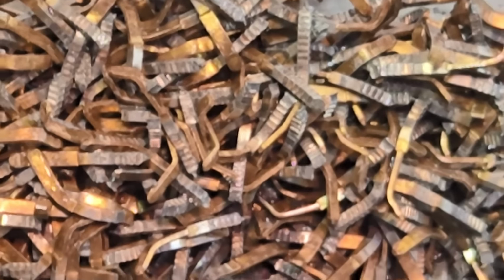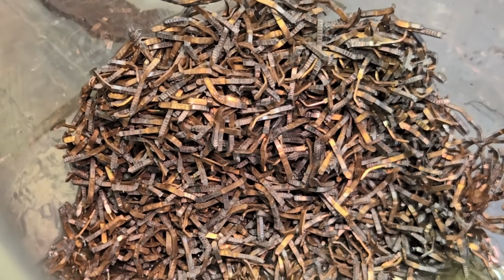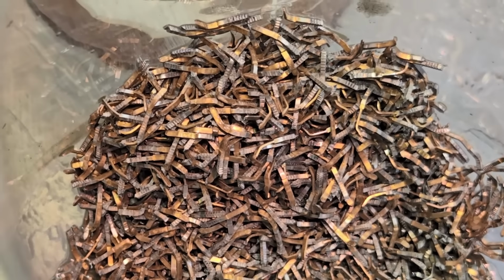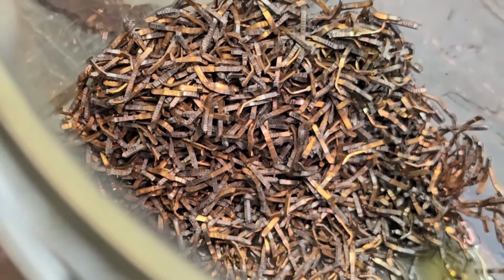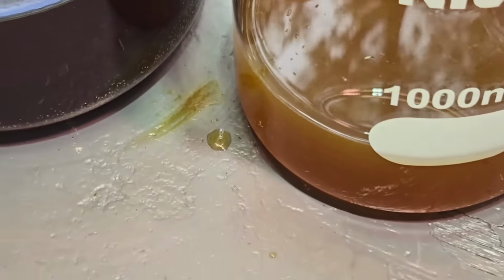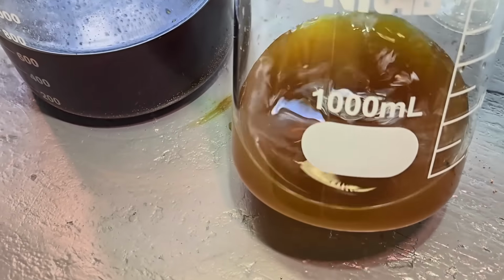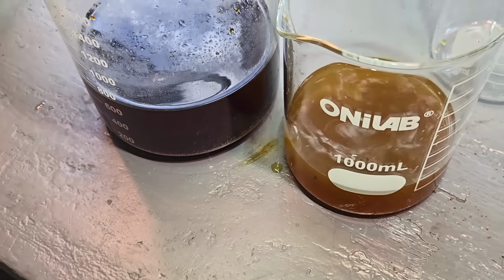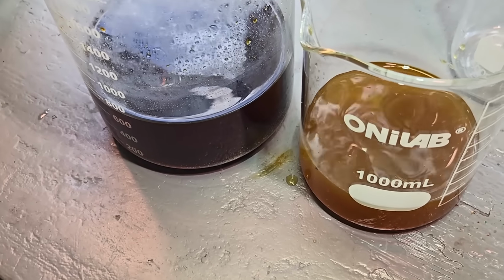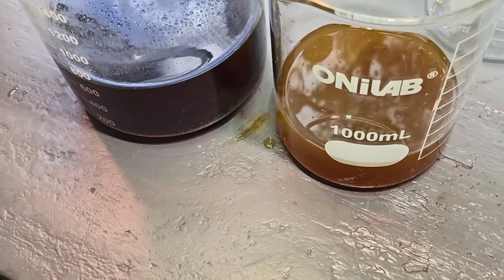I mean, I can still see gold in places, but certainly a lot of it has been removed, and in only 15 minutes, which is pretty darn good, considering it was taking me longer than that to get to this stage before. And look at the difference in the color of the liquid here. What we started with over here and what we poured off. But it's still pretty clear. It hasn't loaded down with a lot of what I assume is tin iodide. So, yeah, okay. This seems to be working.